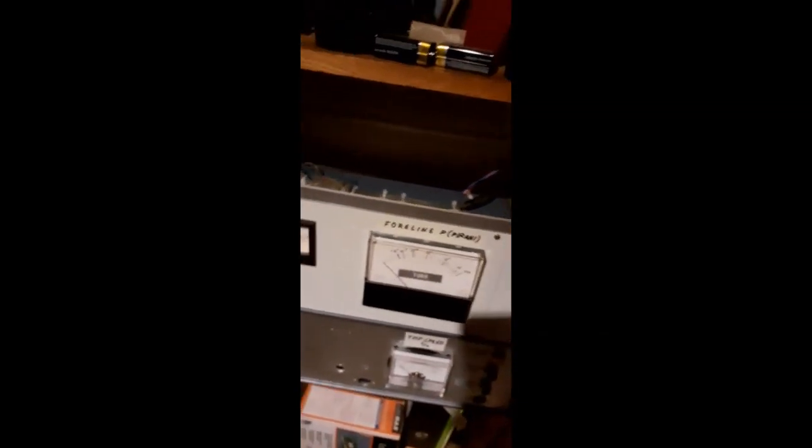I've just connected them and, you know, Legoed together these nice rack units here. Well, nice, that's debatable. But it works. It all works.